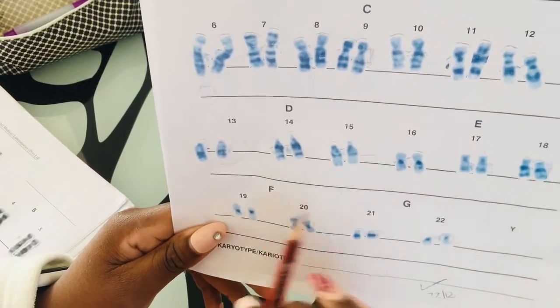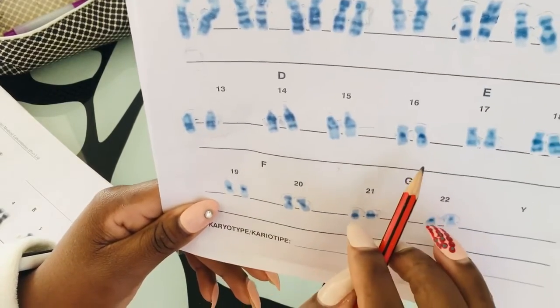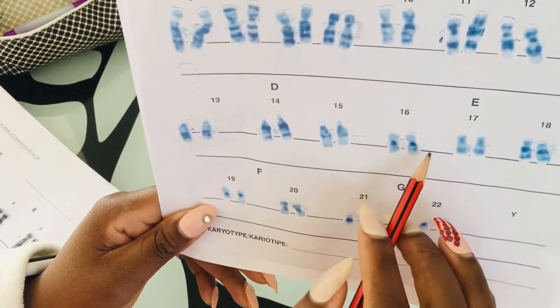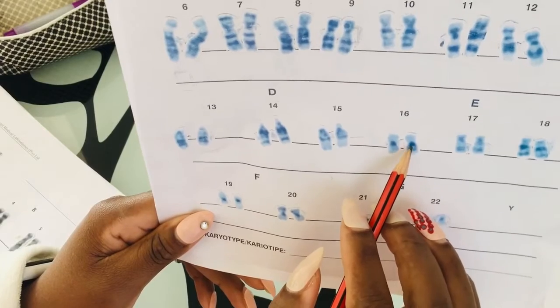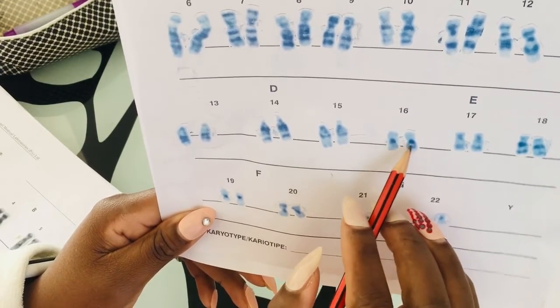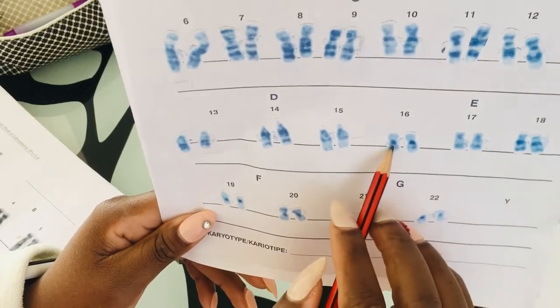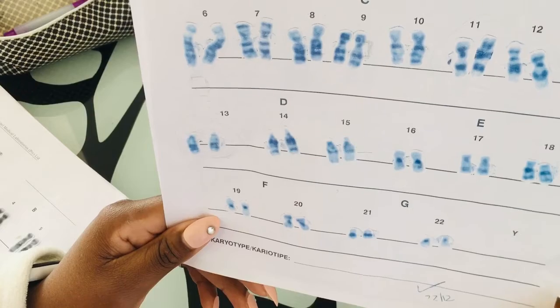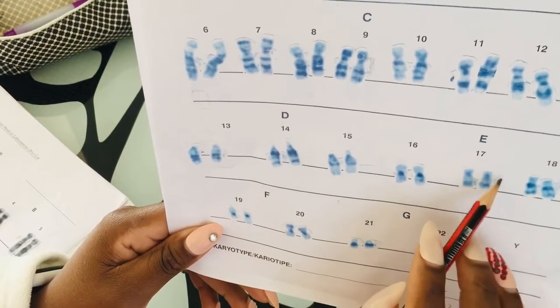Moving to chromosome 16, among the two chromosomes that I learned first, 16 and 19. I used to call it a flower, like a big flower, but it's not a flower. It's chromosome 16. So we have this dark, can you see? It looks like it has a dark centromere or something. So there's also another band here. It's prominent. It's also dark. But the shape looks like a flower. If it's going to help you remember, you can memorize it that way.